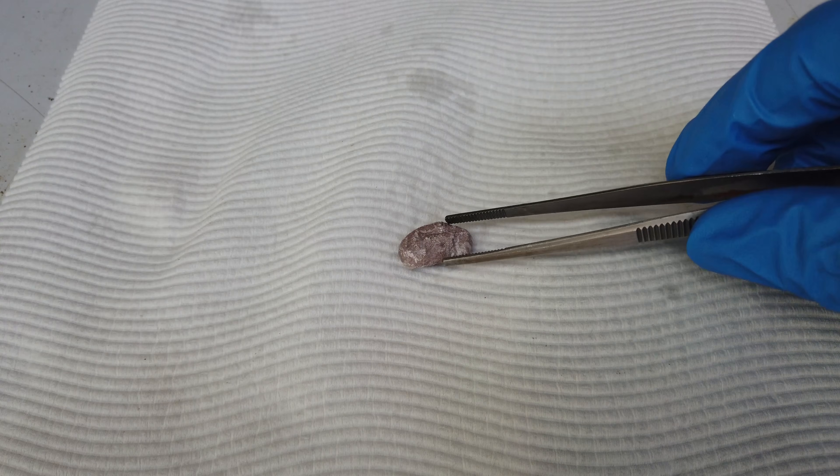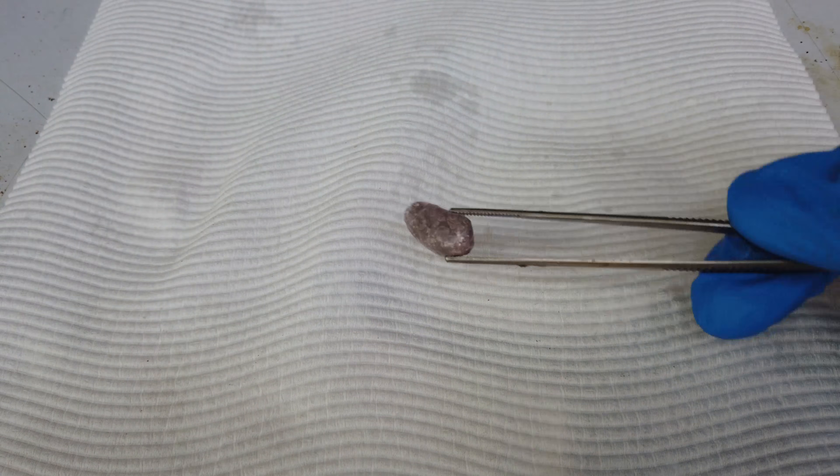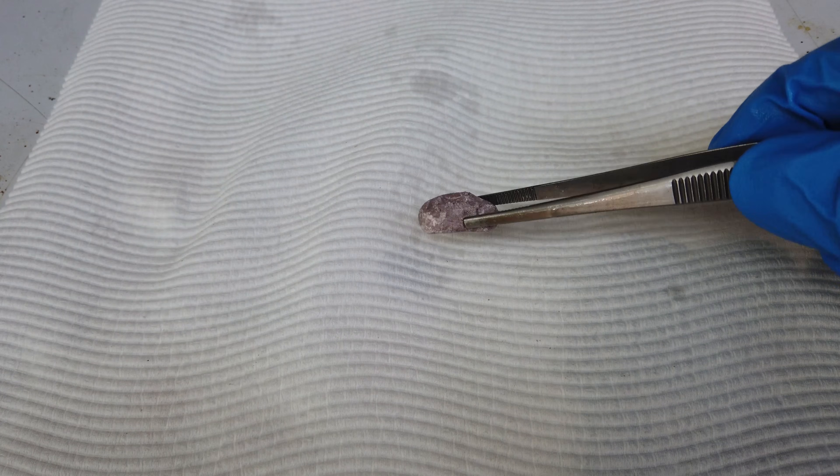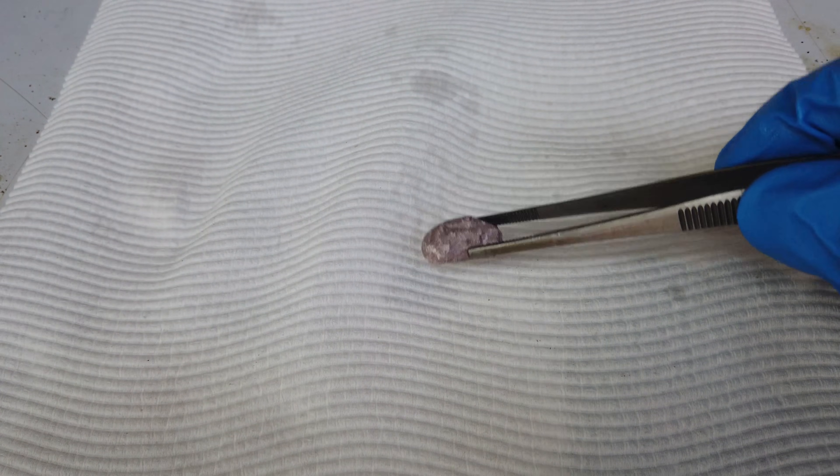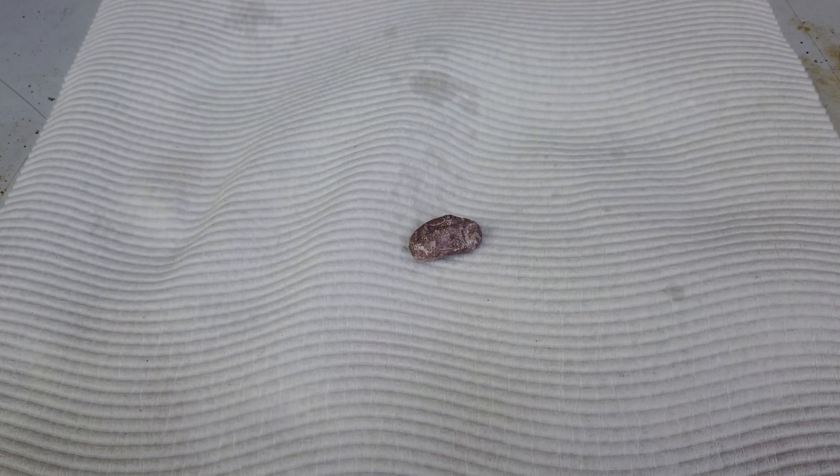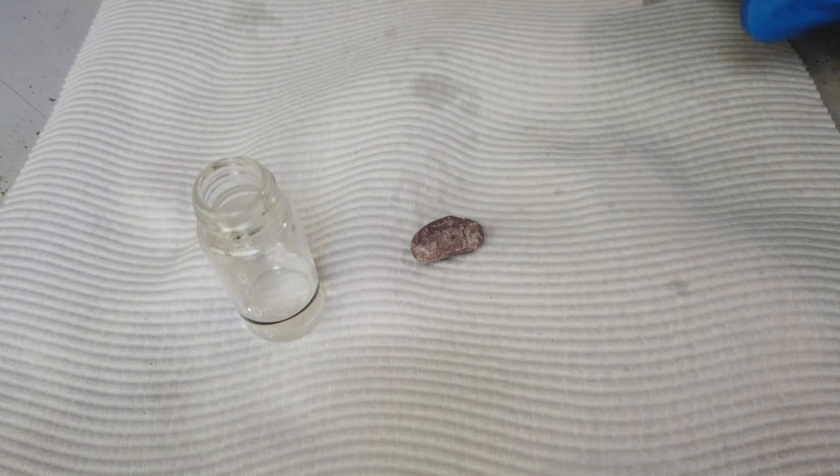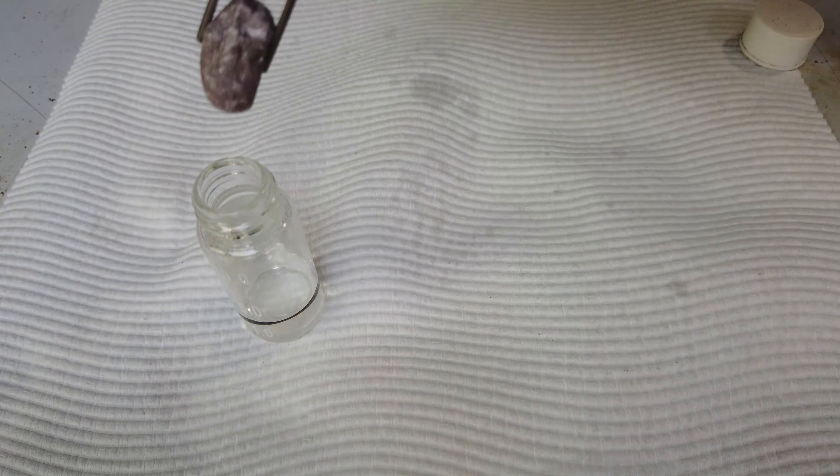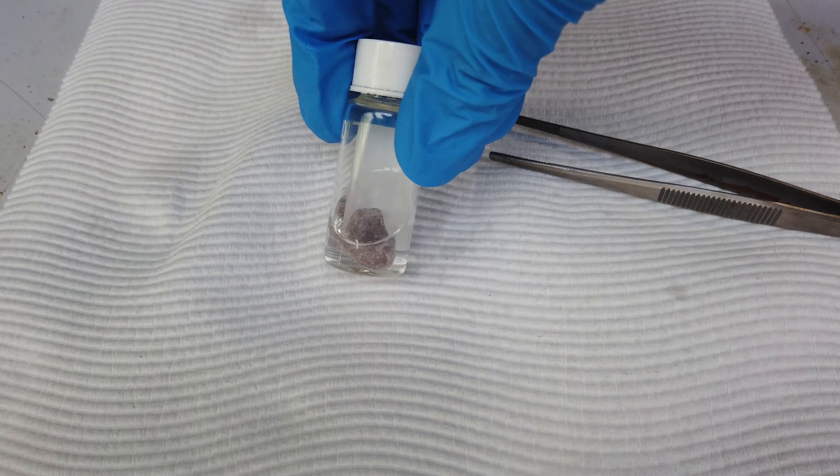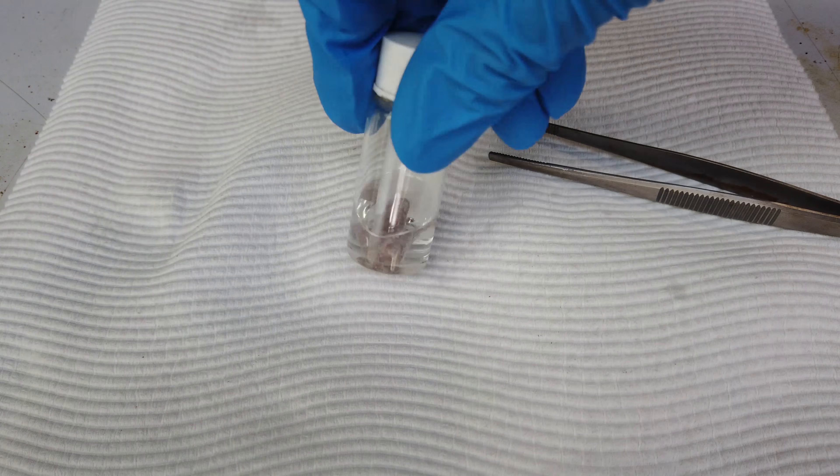Weighing in at 980 milligrams, so close to a gram—that's our chunk of sodium combining the run from today and the run from a few years ago when we made about half a gram of sodium. Anyway, I'll put this away. Hopefully it fits in the bottle. Yes, it does. And that's our sample of sodium we were able to make by electrolysis.